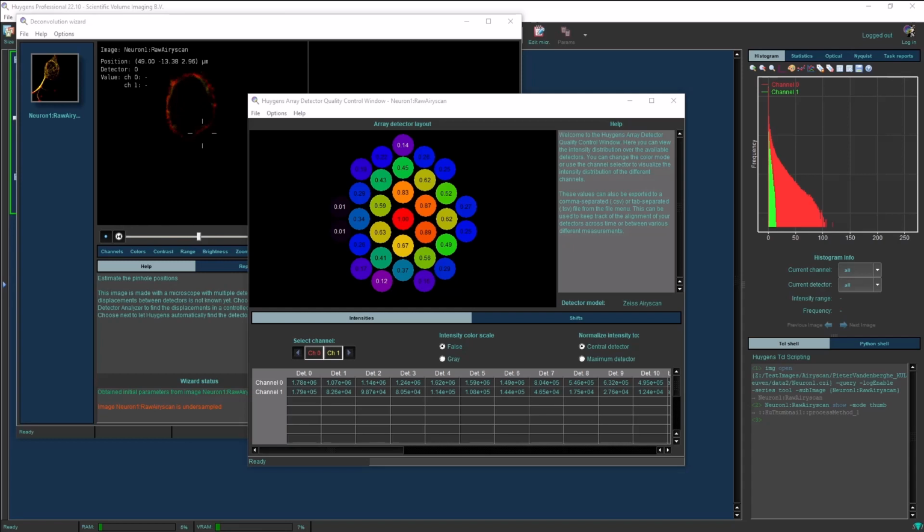For this array scan image, the alignment was done properly, and you can see that the central detector has the most intensity. And as you move towards the outer detectors, the intensity gets less and less. The number inside each circle represents the scaled intensity with respect to the central detector. In the case that the central detector is not the detector with the most light captured, then you can also change it to be colored and normalized with respect to the detector with the maximum intensity. You can do that right here on the right. For this image, there is no difference.